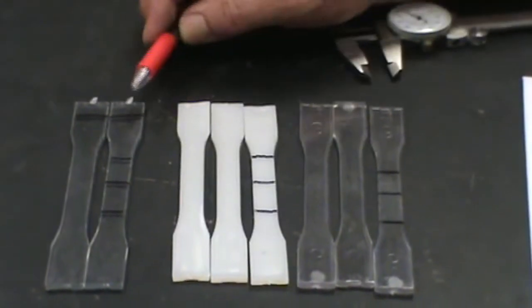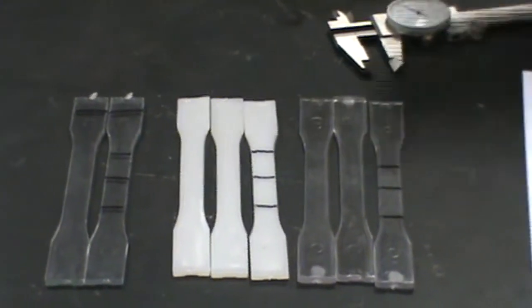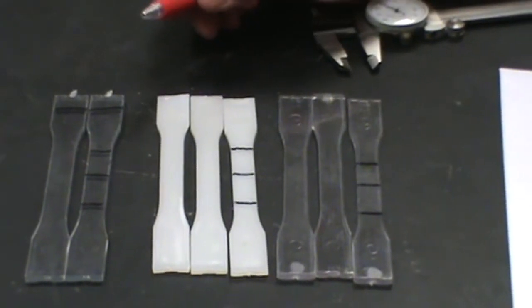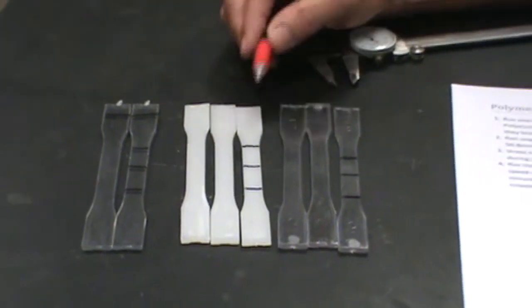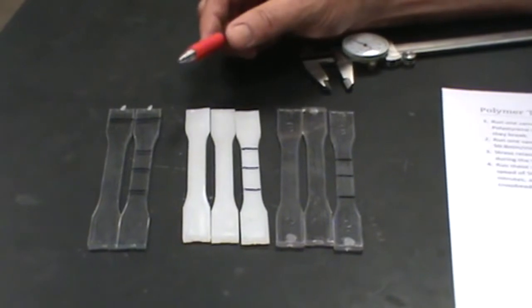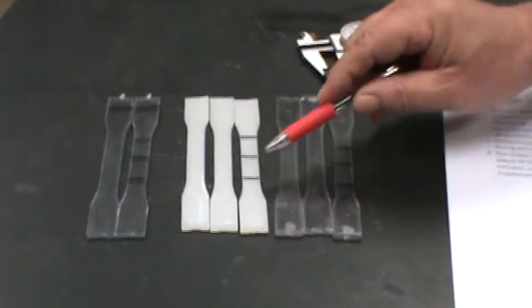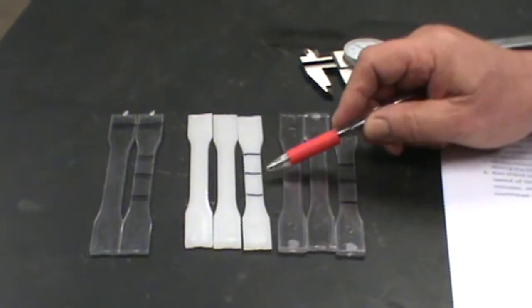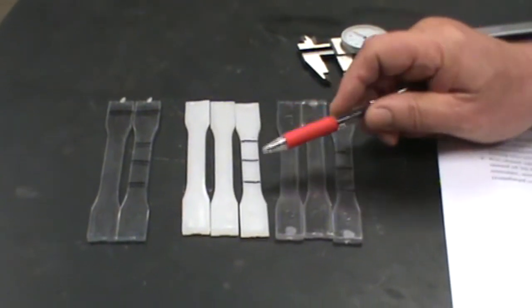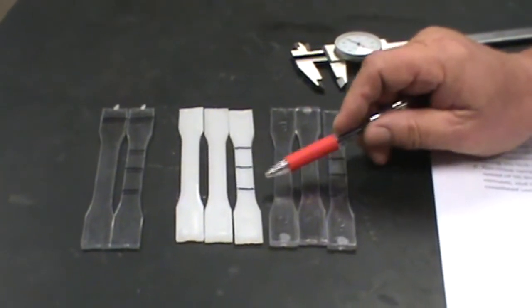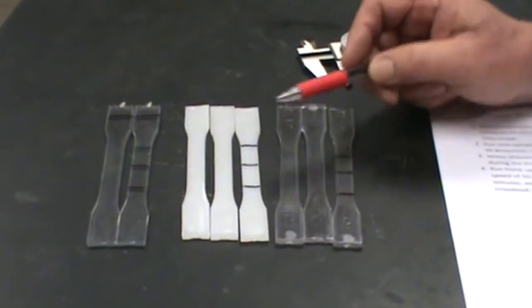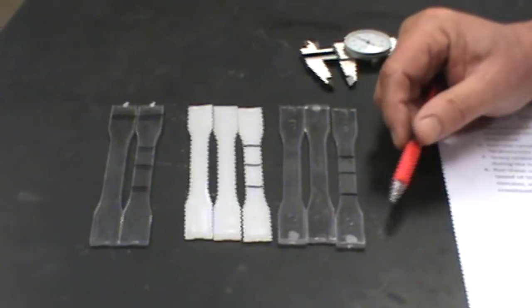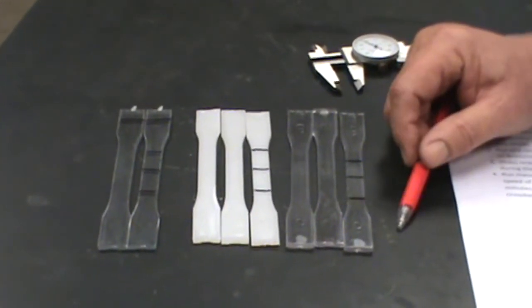What you need to do for your lab is you need to measure your specimens. The best way to do that, you have to set a gauge length. You're going to find the center of your specimen, move over three-quarters of an inch, make a line, move over to the other side, three-quarters of an inch, make a line. That's your gauge length.